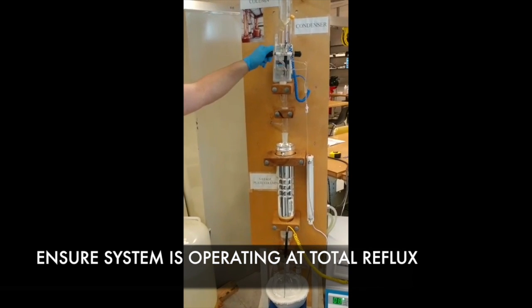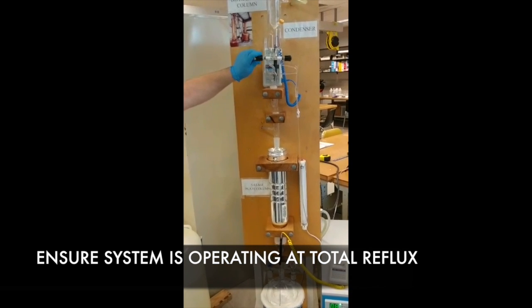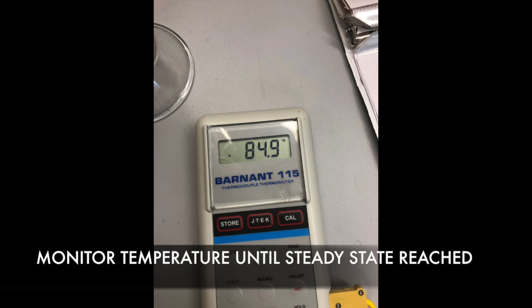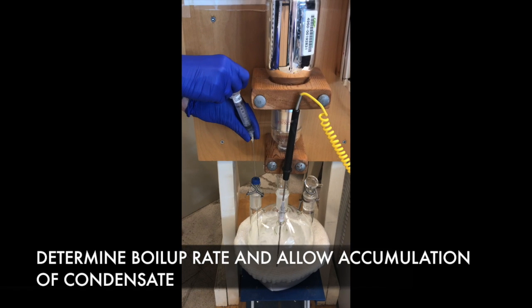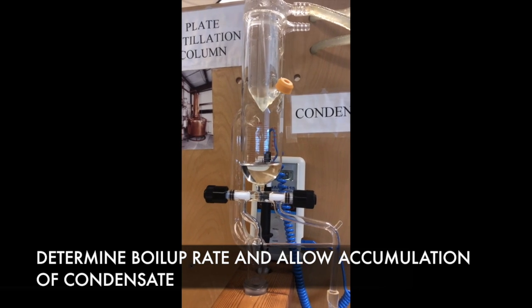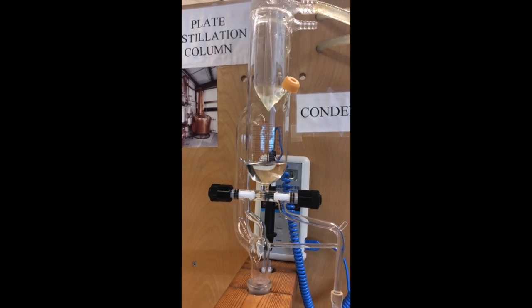The column is operating at total reflux, meaning that the vapor can move up and liquid can move back down freely in the column. Monitoring the temperature, we will allow the system to reach steady state by recording the temperatures at the top and bottom of the column every 2 minutes until we no longer see a significant difference. Once we reach steady state, we will take a sample at the top as well as the bottom so they can be analyzed using the refractometer. After 10 minutes, we will do this again to confirm that the composition has not changed.